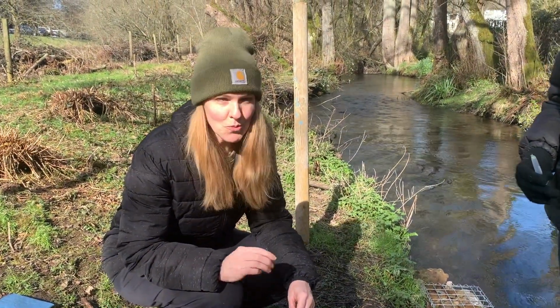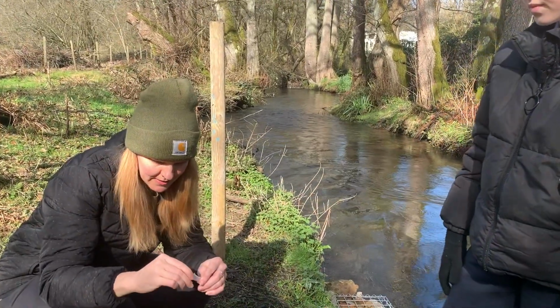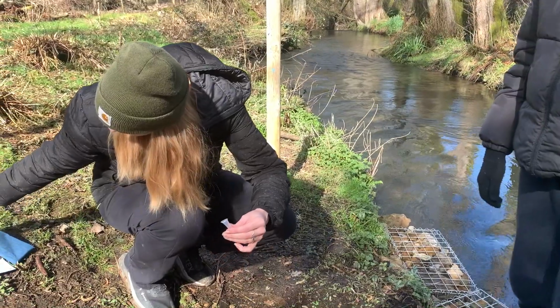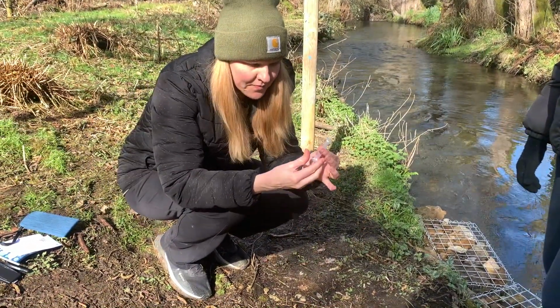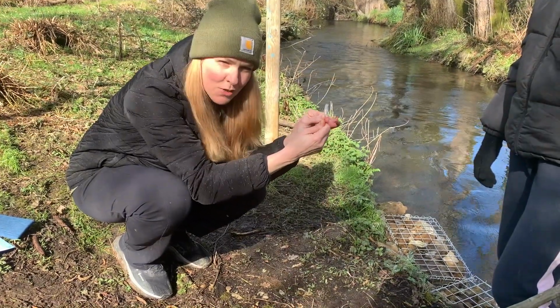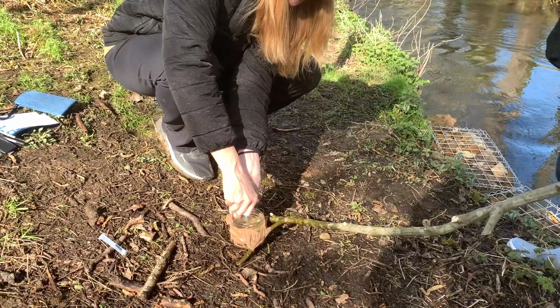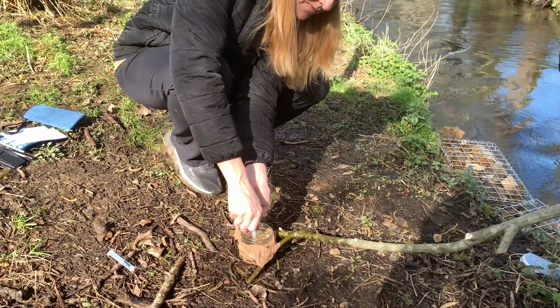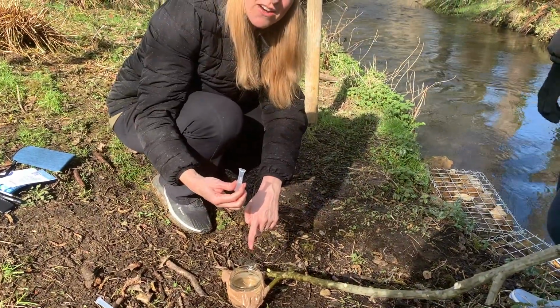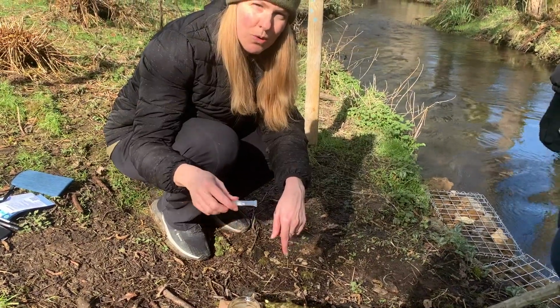Okay, so once 2 minutes is done, I'm going to do my nitrate test. And pull the pin out. Make sure you don't leave that behind. 2 thumbs. Really squish it in the water. Release. Now, if you accidentally get some reagent in there, take another sample. So, when in doubt, do a retest.